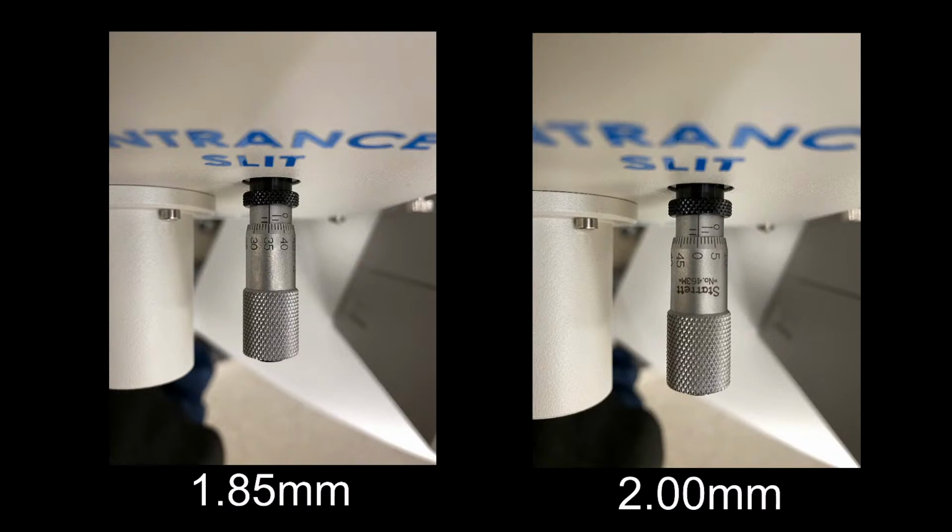You see that the graduations around the knob go from 0 to 50, where you see the numbers 5 and 45. So each little division is going to be 0.01 millimeters, 10 micron. So for every full turn, you're advancing or closing these slits by 0.5 millimeter.